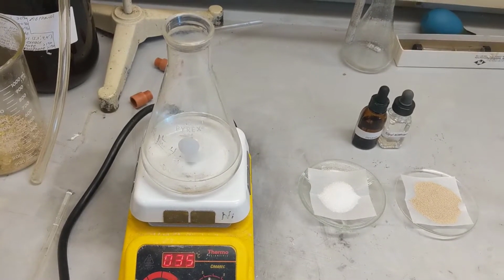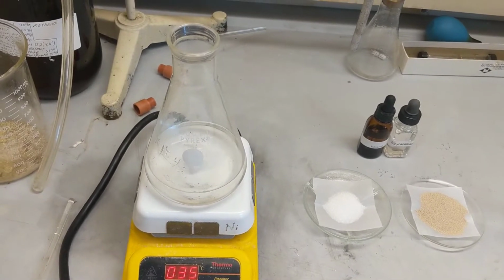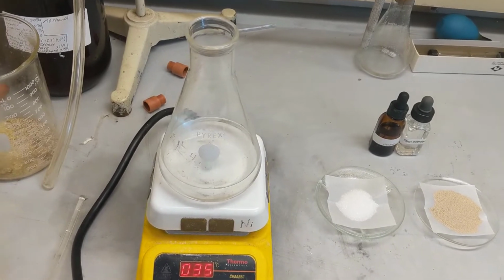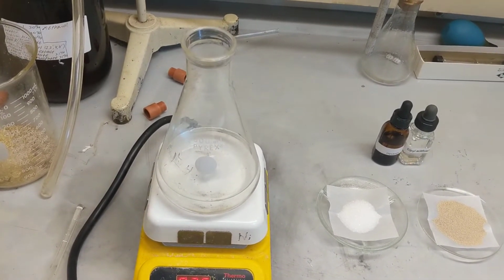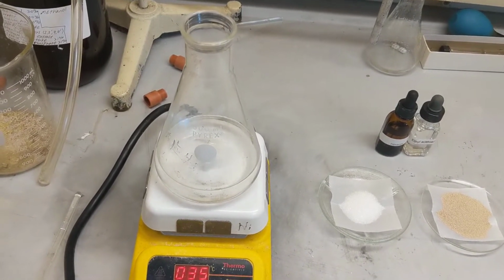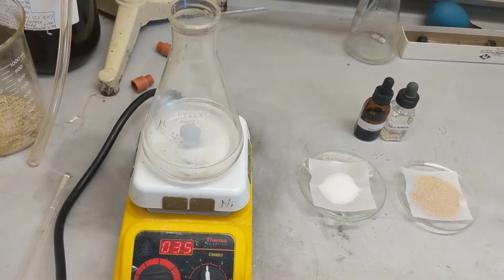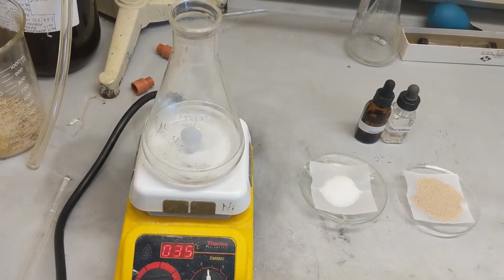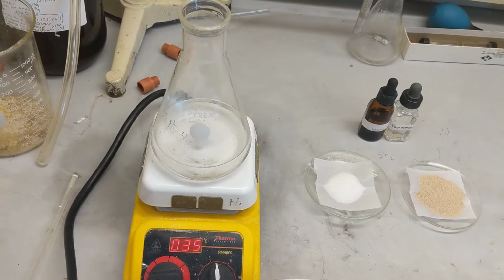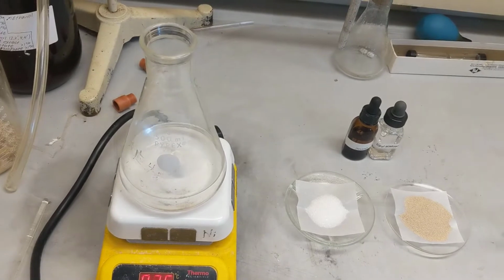Chiral gas chromatography and polarimetry will be employed to determine the percentage of each enantiomer. Generally, in the chiral reduction process, less than 8% of the ethyl R-3-hydroxybutanoate is formed. In contrast, when ethyl acetoacetate is reduced with sodium borohydride in methanol, the reaction gives a 50-50 mixture of R and S stereoisomers. A racemic mixture is formed because the reaction is not conducted in a chiral medium.